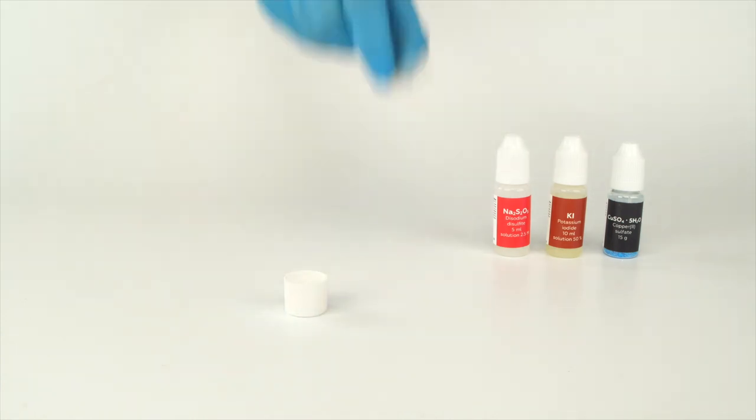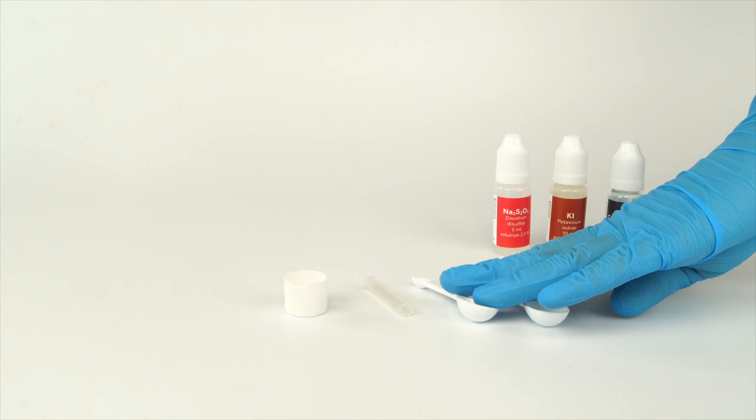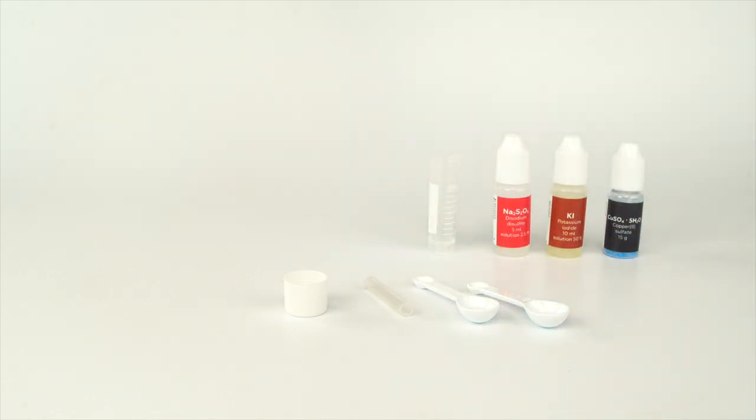Take the cap, the silicone tube, two measuring spoons, the graduated cylinder, the plastic lid, and the wooden stick from the experiment set. Take the beaker from your starter kit.